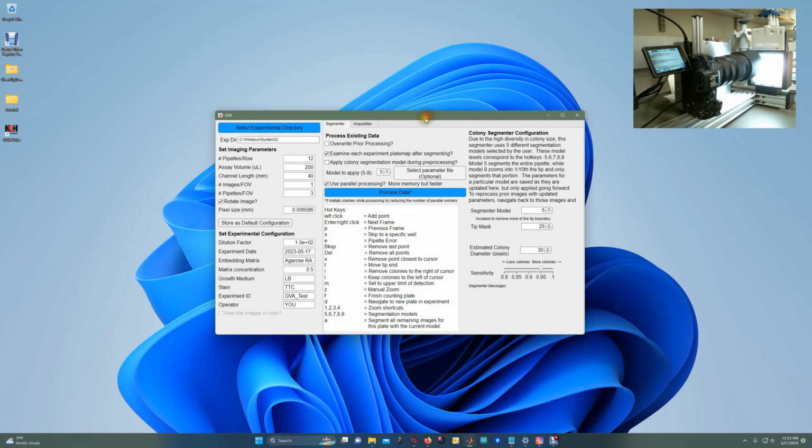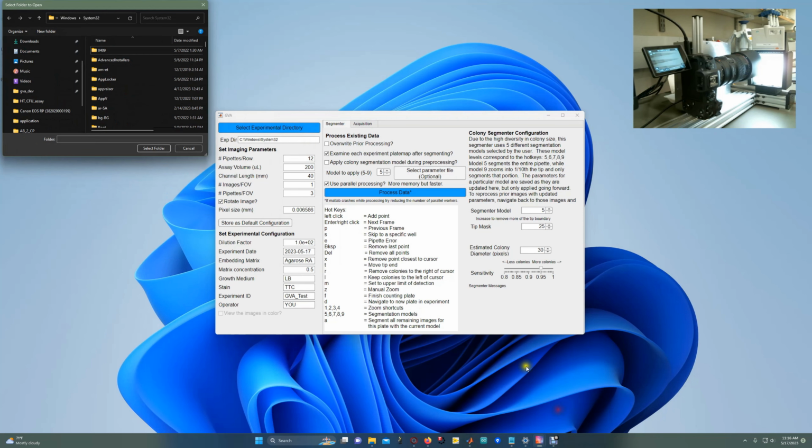Alright, in this tutorial I'm going to talk about how to use the acquisition tab to acquire data using the optical box that was included on the GVA website. The first step is to select the experimental directory where the data is going to be stored.